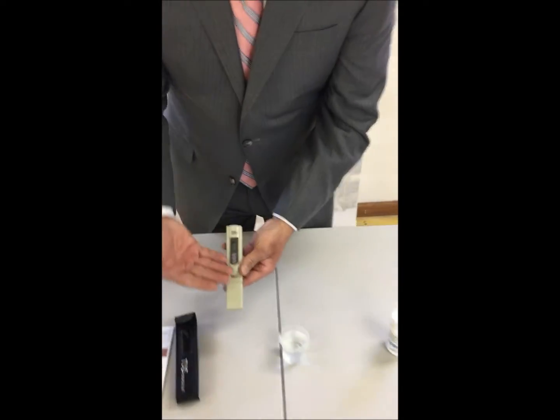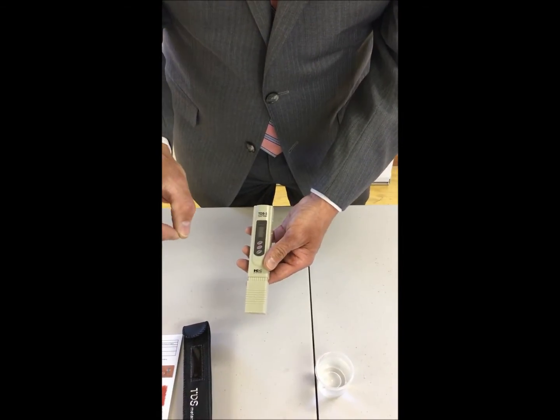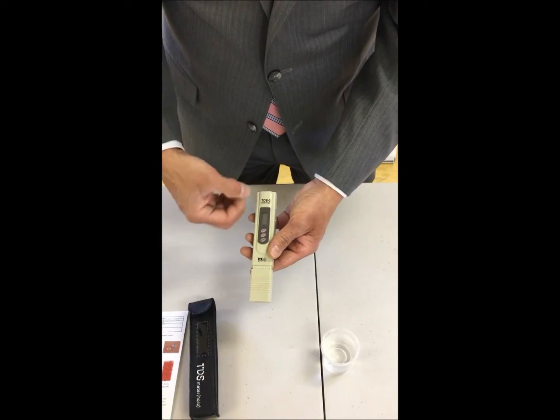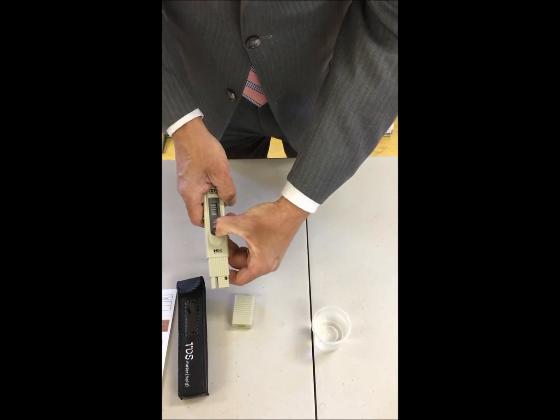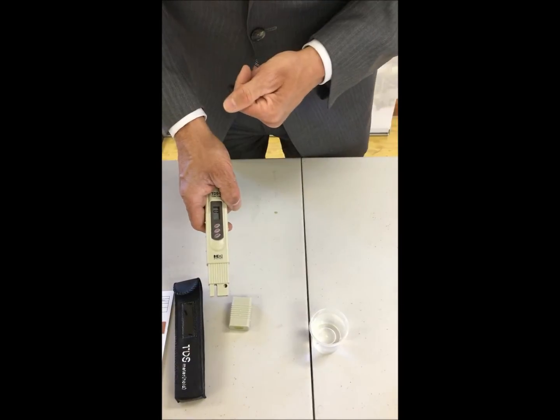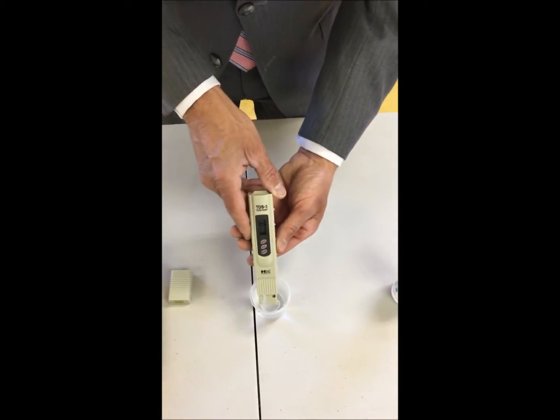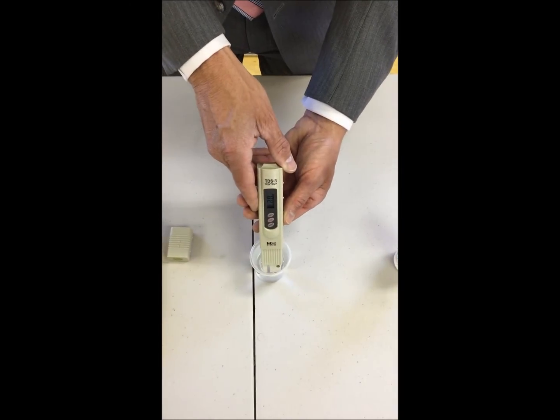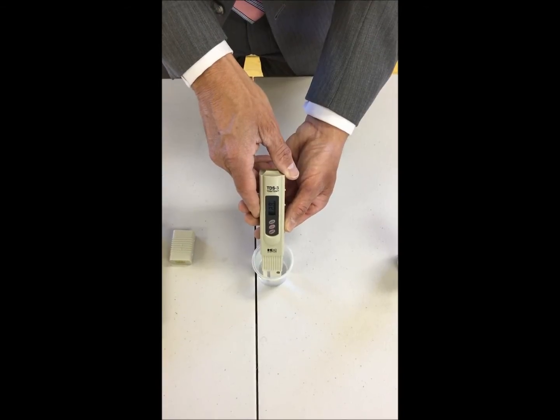This conductivity tester will measure both our conductivity as well as our temperature. Simply remove the cap, press the bottom button. You'll then see figures illuminated on the screen. You dip it in your sample of water. That number will change. Whatever the number is, you simply record it and note it on the paper log sheets we gave you.